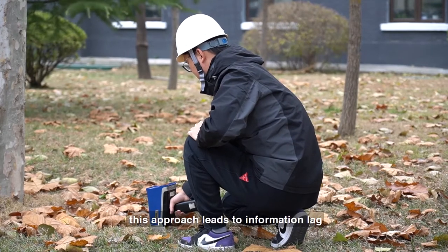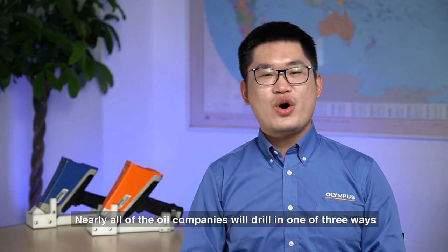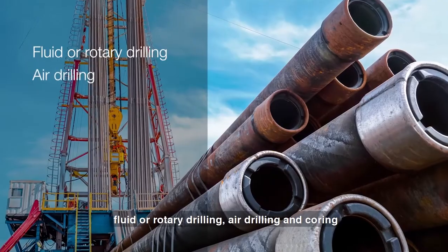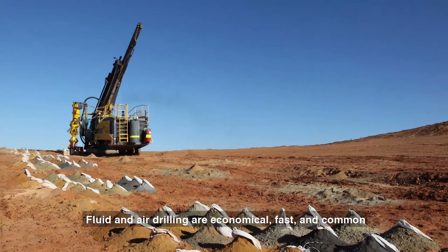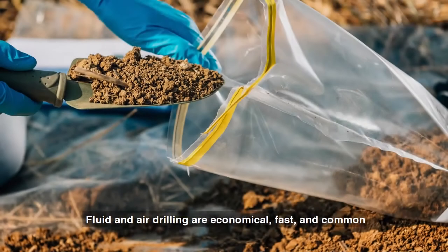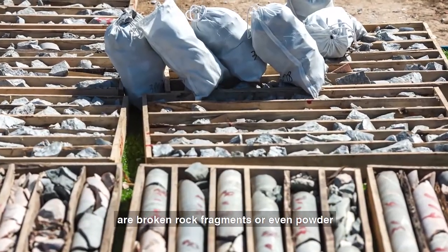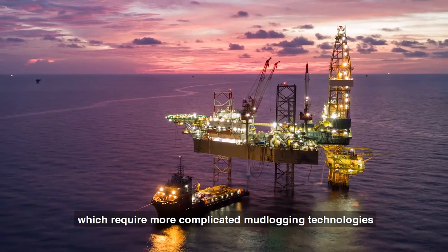This approach leads to an information lag. Nearly all oil companies will drill in one of three ways: fluid or rotary drilling, air drilling, and coring. Fluid and air drilling are economical, fast, and common, but the resulting geological samples are broken rock fragments or even powder, which require more complicated mud logging technologies.